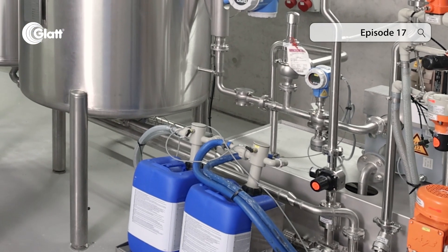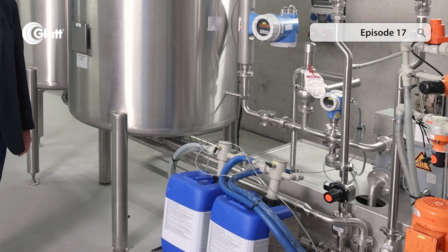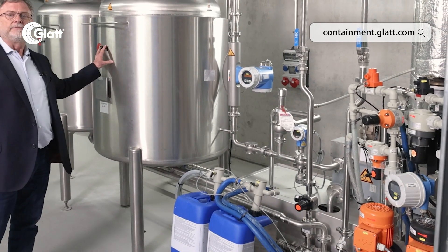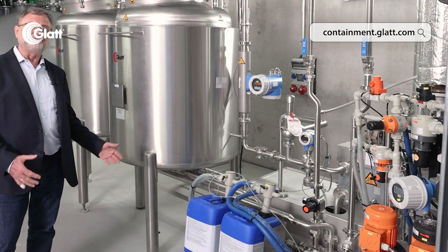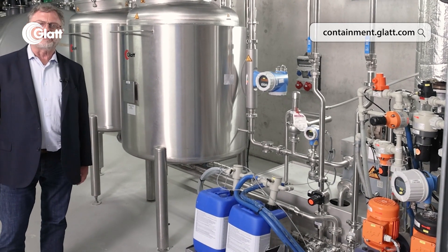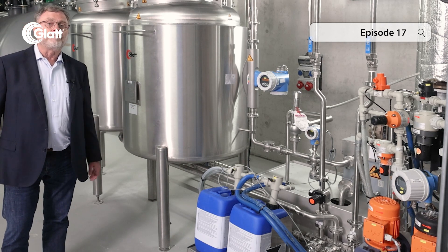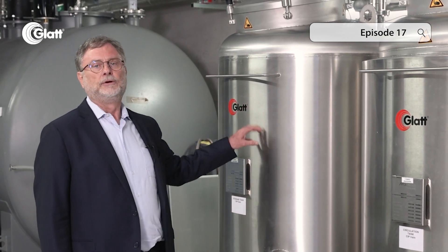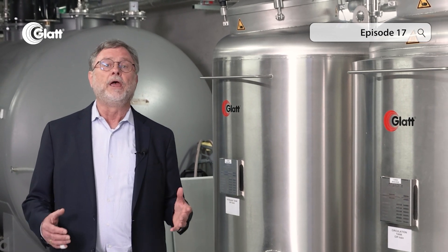What do we see here? This is a recirculating cleaning station. In certain process steps, the cleaning medium is recycled from the process machine to the recycling tank and reused for the next cleaning cycle in the same process step. This reduces the consumption of detergents and energy significantly. The second tank is used for storing purified water. The flow in the cleaning process is around six cubic meters per hour. Quite often the supply of purified water is less than this, but for a good cleaning result we need six cubic meters per hour, so the required quantity is stored in this tank shortly before the last rinse with purified water is started, and the booster pump will then be able to provide the required flow.